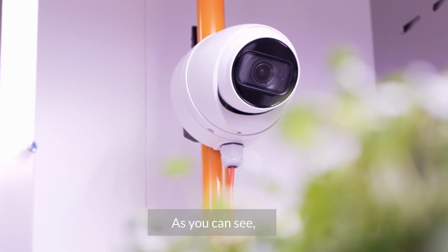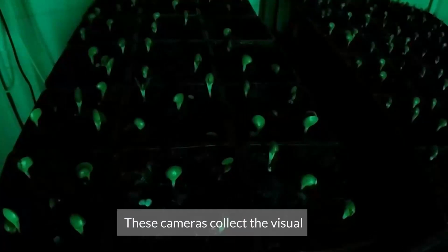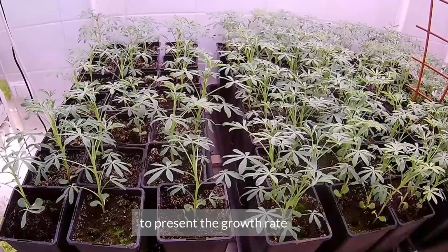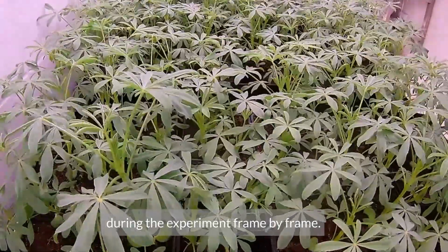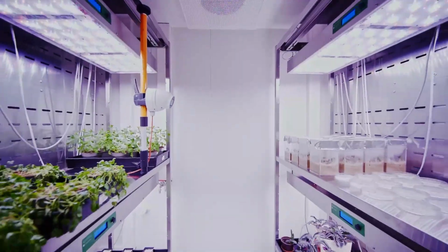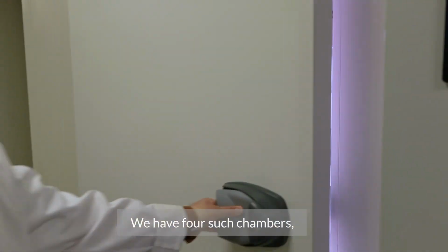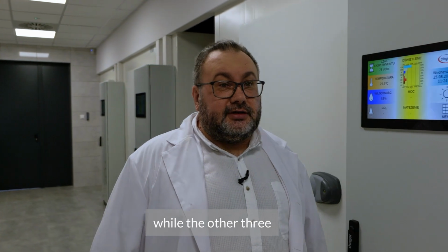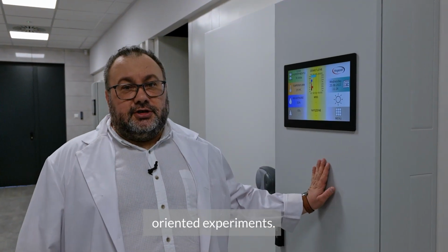As you can see, each chamber is equipped with a camera system. These cameras collect the visual data continuously and allow us to present the growth rate and the growth of plants themselves during the experiment frame by frame. We have 4 such chambers, one of which will be prepared only for production conditions, while the other 3 can be used to conduct strictly research-oriented experiments.